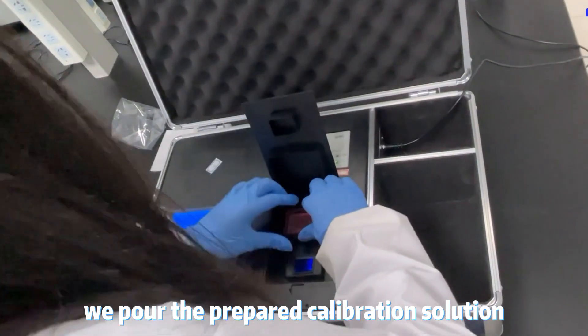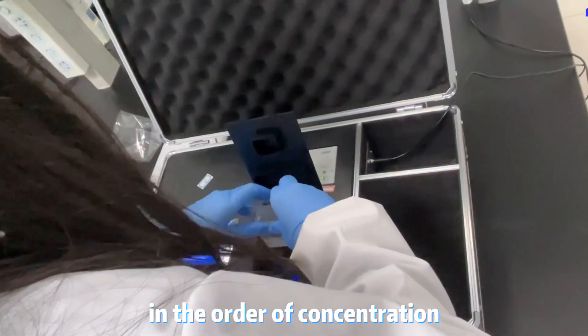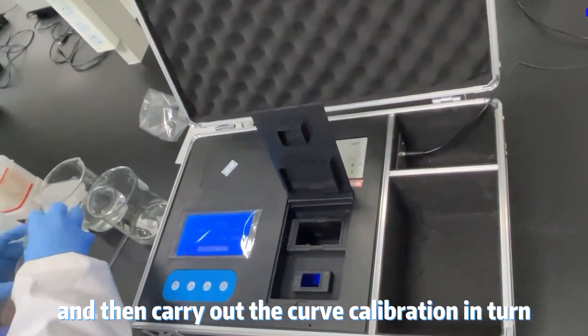We pour the prepared calibration solution into the cuvette of the instrument in the order of concentration, and then carry out the curve calibration in turn.